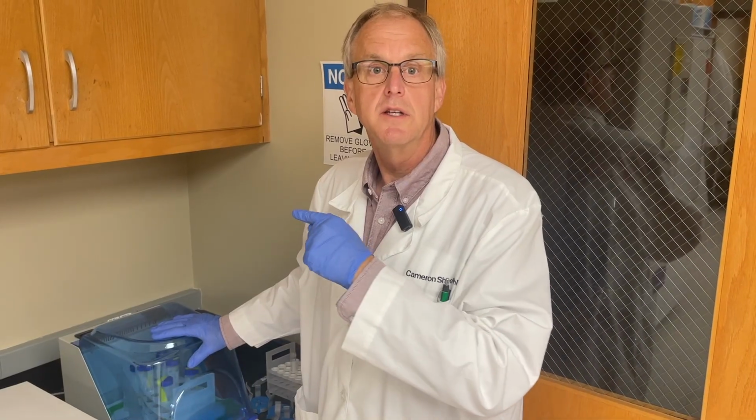Tomorrow, we can use each of these tubes for plasmid isolation. This concludes today's saga. The bacteria took up the plasmid. We're able to isolate individual colonies. The negative controls work beautifully. I just love happy endings.